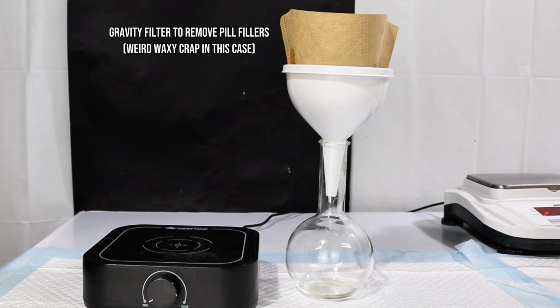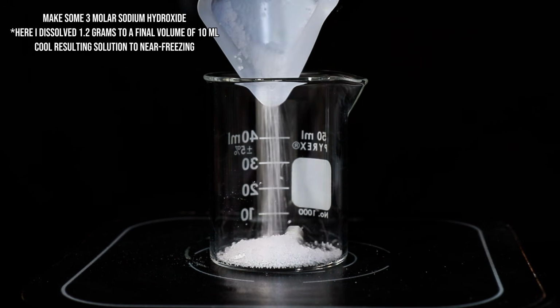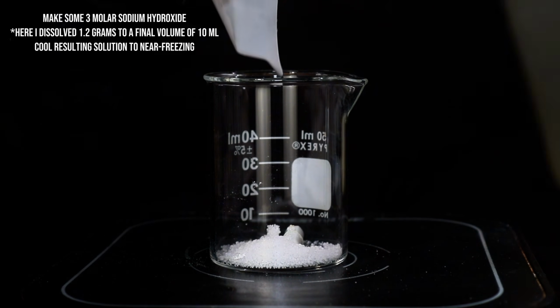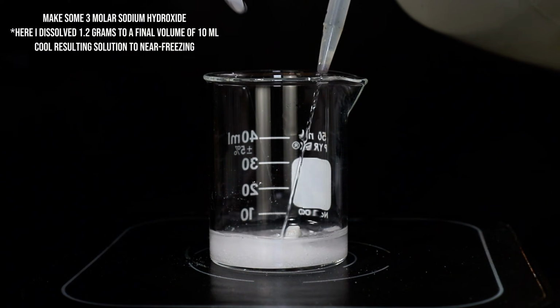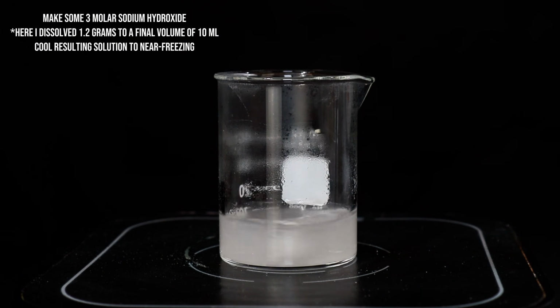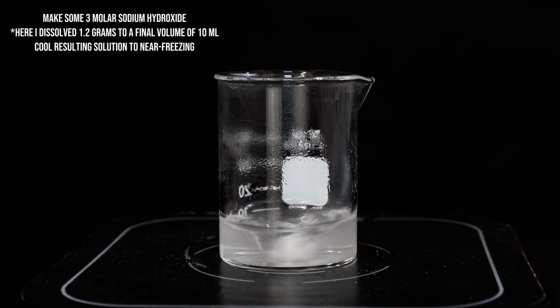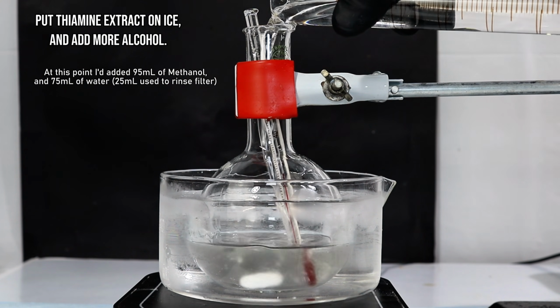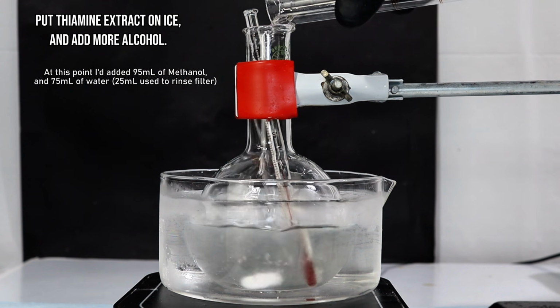Meanwhile, I dissolved 1.2 grams of sodium hydroxide in a minimal volume of water, and then diluted this to a final volume of 10 milliliters. This roughly 3 molar mixture of sodium hydroxide was then placed on ice and allowed to cool below 10 degrees Celsius. As soon as the thiamine extract was done filtering, I went ahead and put the boiling flask on ice and added 75 milliliters of cold methanol.